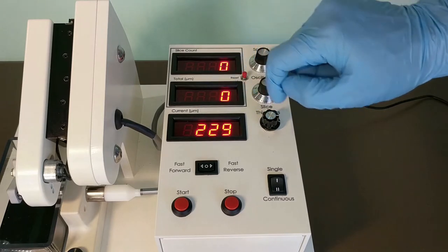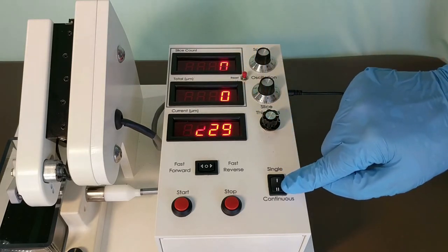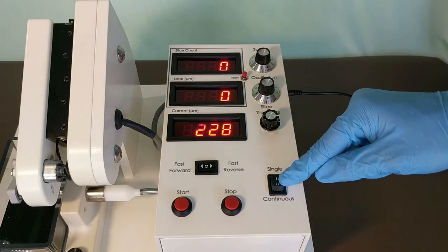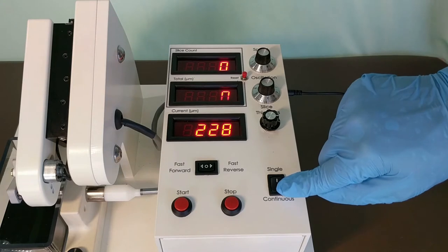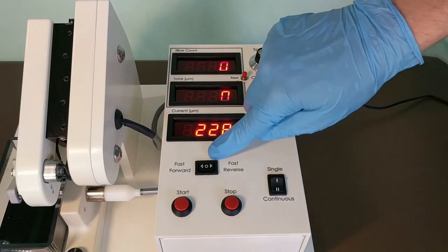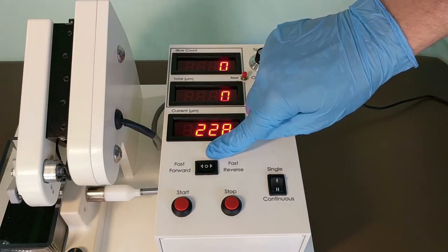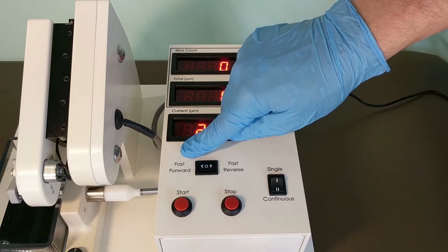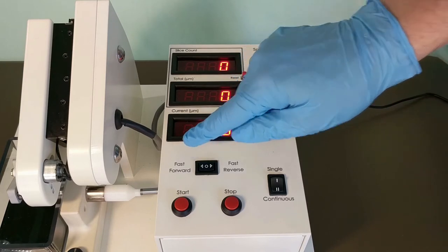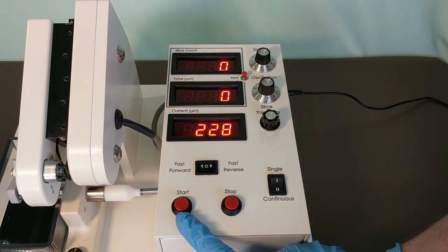Additional controls include single or continuous sectioning, fast forward and fast reverse for the micrometer, and start and stop.